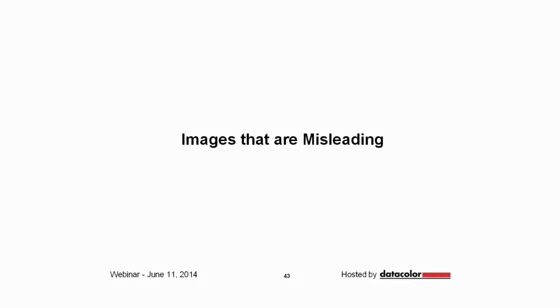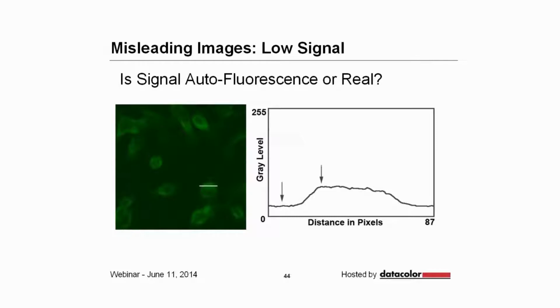So let's now go on to the sorts of images that are misleading and the kinds of images that we would anticipate a reviewer, an editor, or someone who's actually looking at your work to contest. So first, is your signal real? In this instance, you can see that the signal is very close to the background. You could increase your contrast and exposure, but look at the difference between the background and your image itself. Here I drew a line and made a line profile, and you can see by the arrows that there isn't much of an increase from the background to the actual fluorescence. And so in this instance, you would really have to go back and review your bench techniques and figure out how you can improve your signal to background problem.